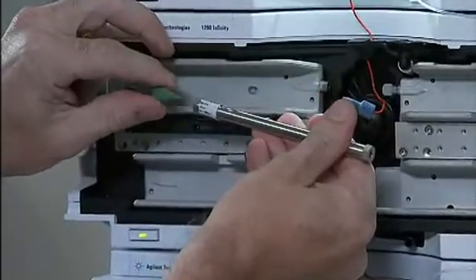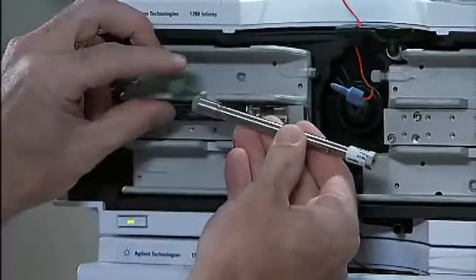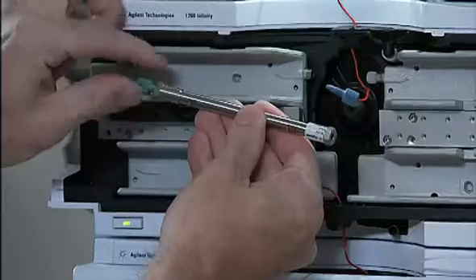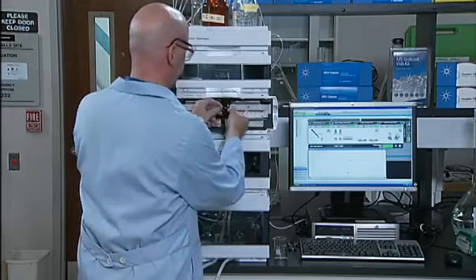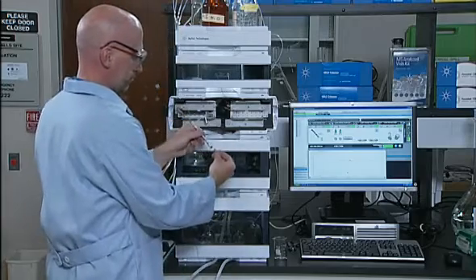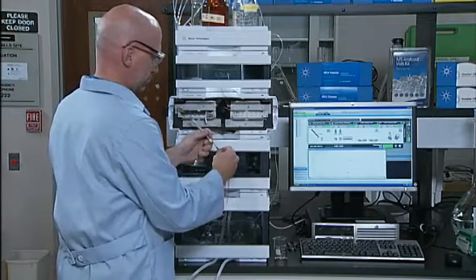You take the column, remove it from the system of course, and connect the outlet to the inlet tubing from the pump. Pumping water, acetonitrile, or your mobile phase through the column for a period of time may end up dislodging some or perhaps all the particles that are clogging the inlet. Note that even though you may be able to turn a column around like this for backflushing, it's not always recommended you run the column in this backwards position for an extended period of time.